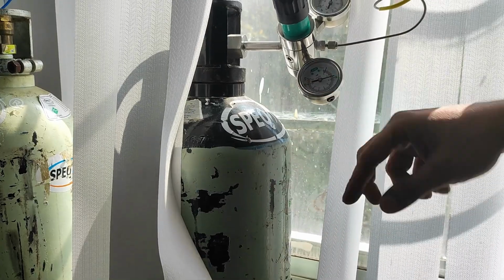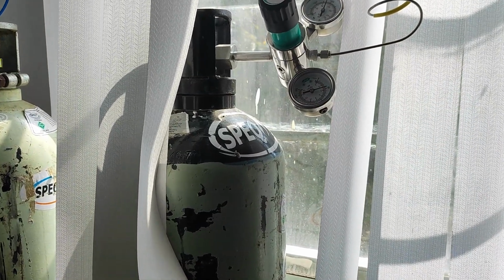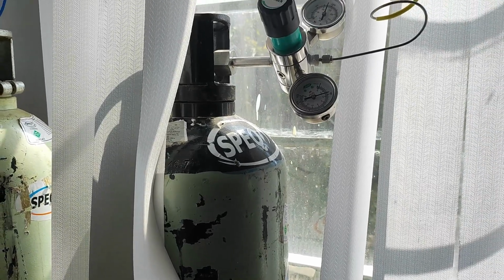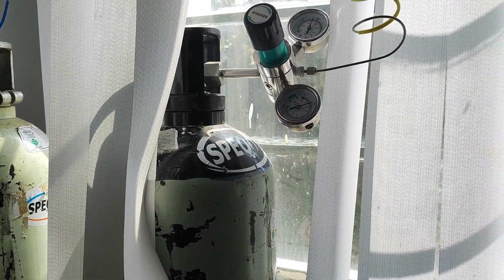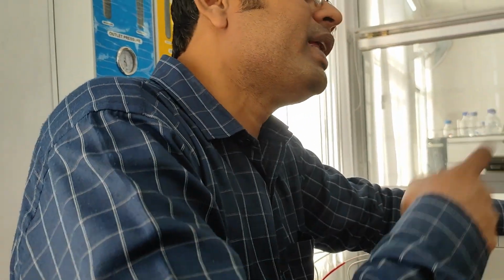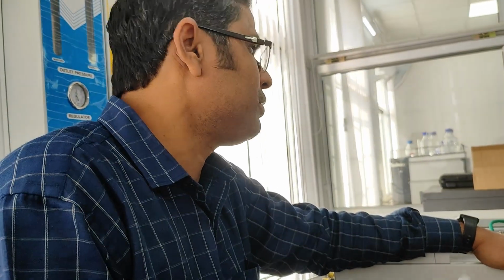This is also used as a carrier gas. We will use this carrier for the ECD line, and for TCD and FID we will use argon as a carrier. If you use nitrogen as a carrier, you will not get a nitrogen peak, because nitrogen will always be there. Your sample contains a very small amount of nitrogen that will mix with your carrier gas, so you cannot get a separate nitrogen peak. You have to keep in mind that whatever you use as carrier gas, your sample should not contain that.